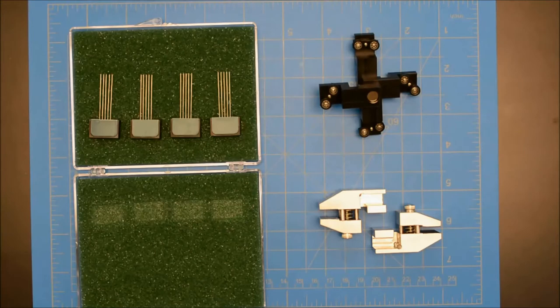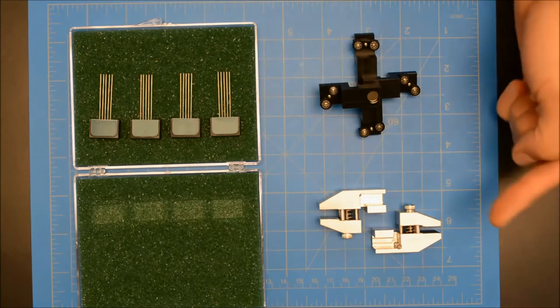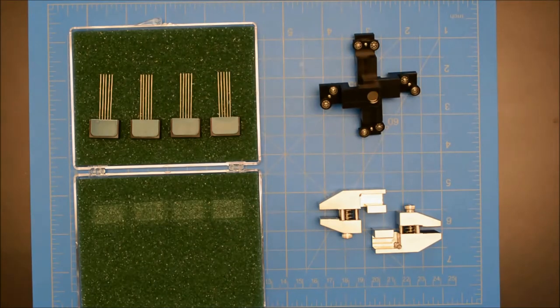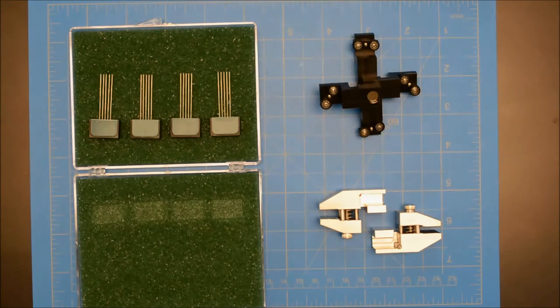In addition to biaxial testing, we occasionally do uniaxial testing. At that point, we use the clamps. For more challenging applications when shear is present, we use the pulley system. This system allows the sample to rotate freely during testing.